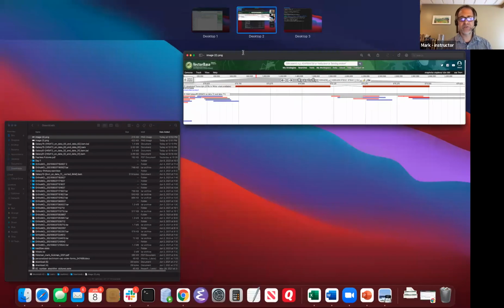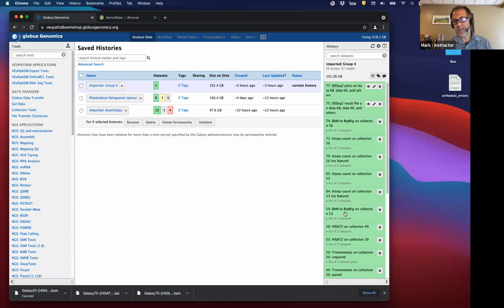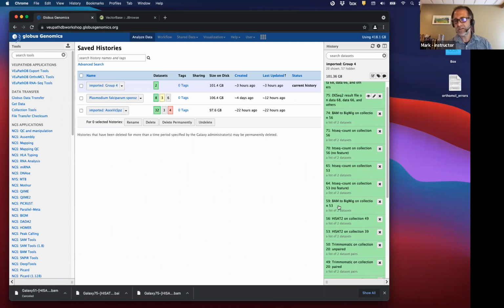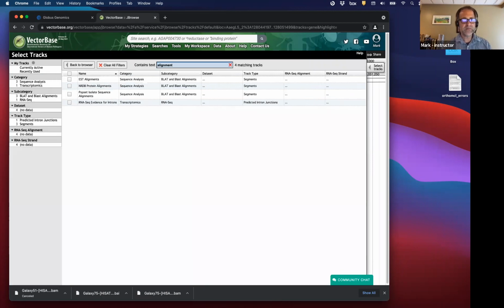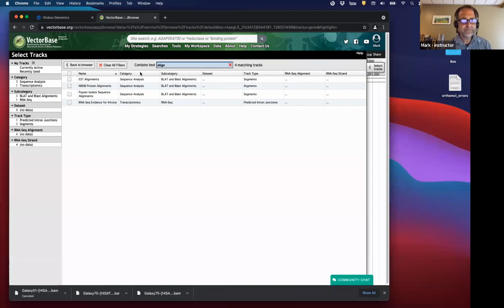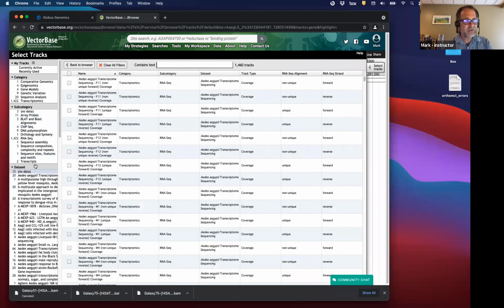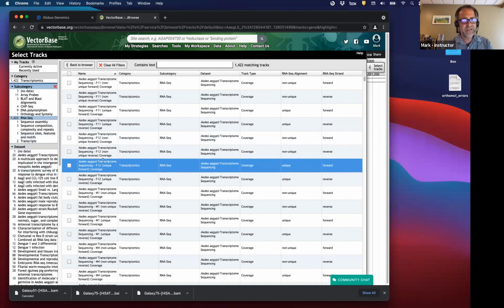Then we have the BAM file. That's the alignment file. And the BAM file is really useful in two ways. One, converting it to a Bigwig. You've seen tracks that are Bigwig files, and that is the coverage track. So I can just look for alignment here. I could clear this. Why am I not seeing it? It must be called something else here. Anyway, do you remember that histogram that tells you how many reads map to that location? So that's what a Bigwig file is. You've seen it already.